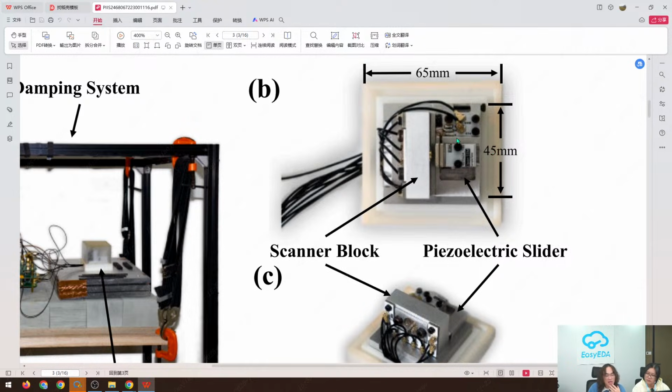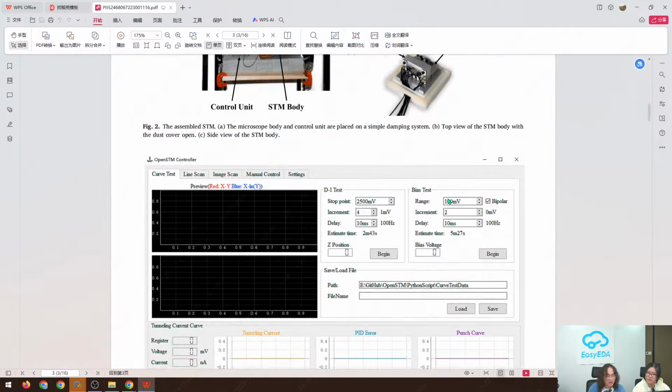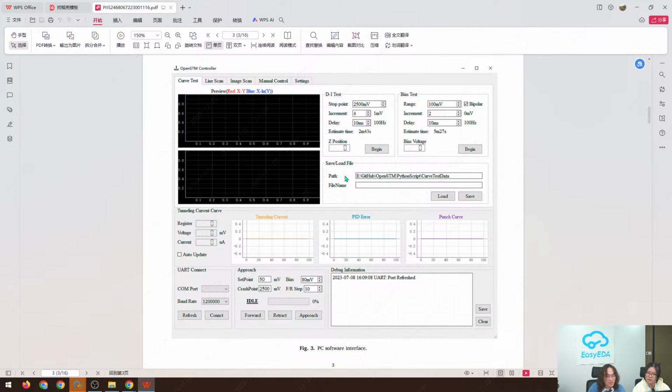And when the STM is working, the sample can be loaded here, and the slider here can bring the tip and sample into the range of the scanner. After that, we can use our scanner to establish a tunneling current. After that, we can just design our software to accomplish this procedure automatically. And this is the software. I programmed it with Python and Qt.